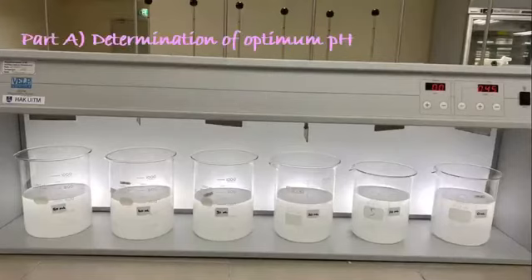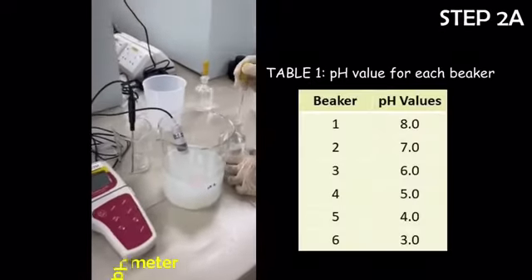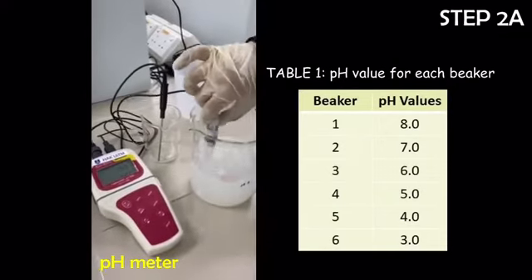The experiment for determination of optimum pH for turbidity removal was carried out by pouring 600 milliliters of synthetic wastewater into six 1-liter beakers. The pH of the wastewater samples in each beaker was adjusted according to Table 1 by using 1% sulfuric acid or 1% sodium hydroxide.